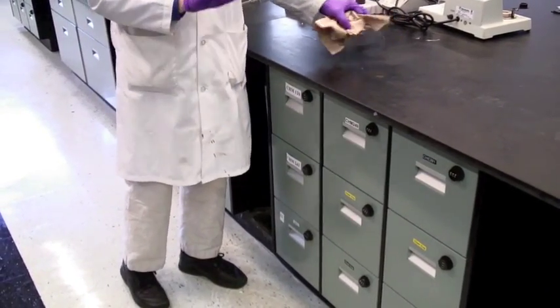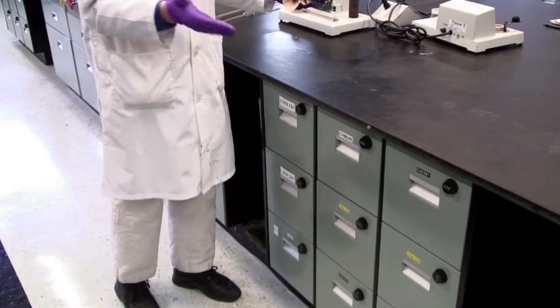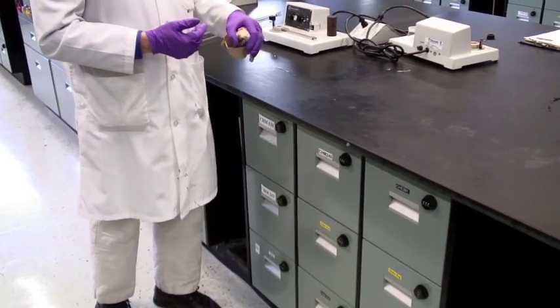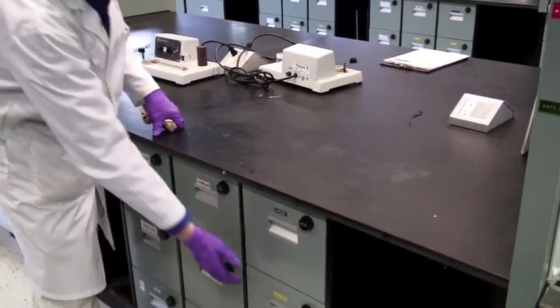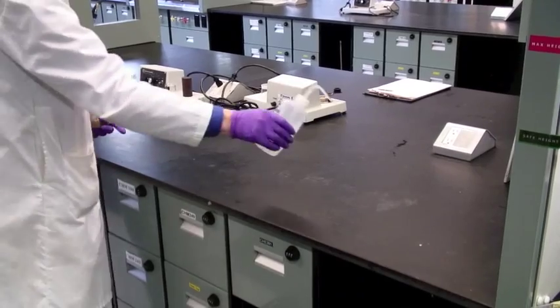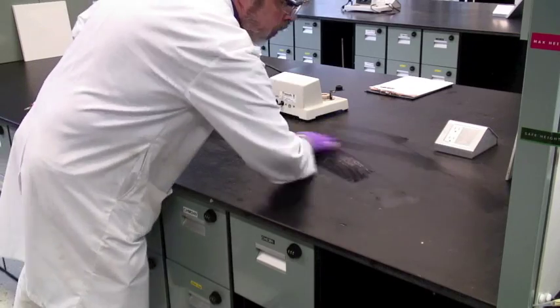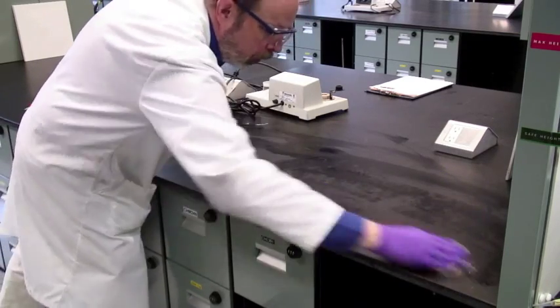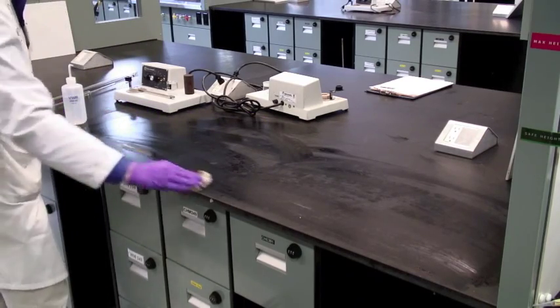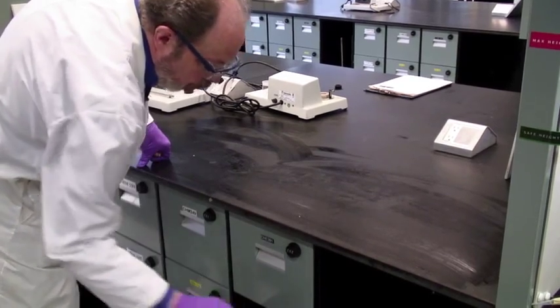Please make sure that you have cleared everything off. Once you have cleared all the glassware away, either into your locker or the drawer under the fume hood, or back to the common areas, your bench needs to be cleaned. So take your distilled water, get it wet. Use a damp paper towel to clean down your bench space. Make sure you're not leaving guck behind for the person next day to be dealing with. And then your distilled water can go away.